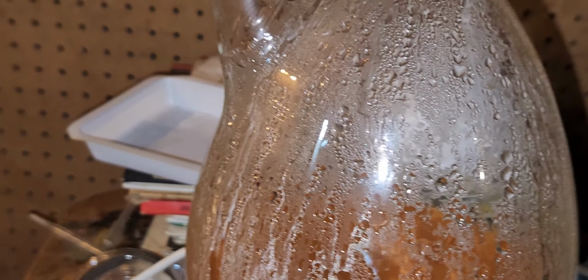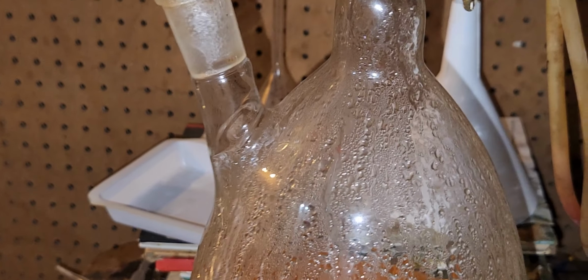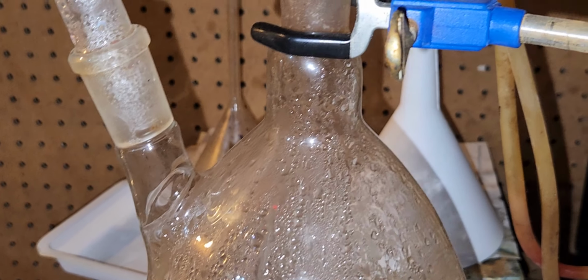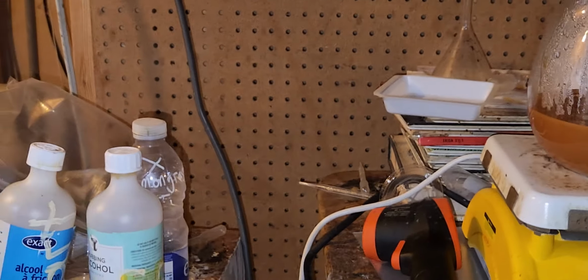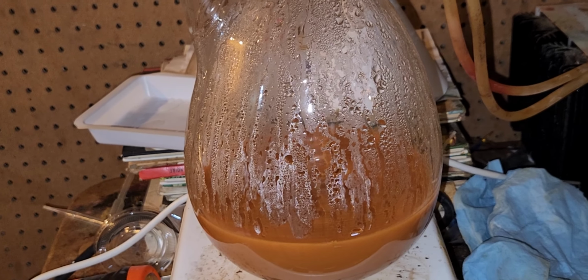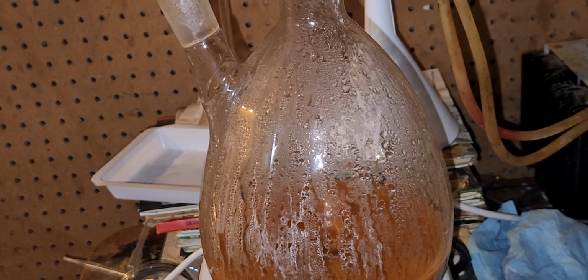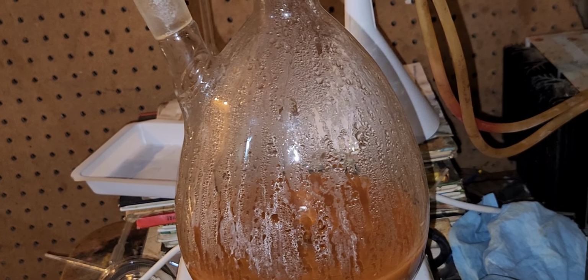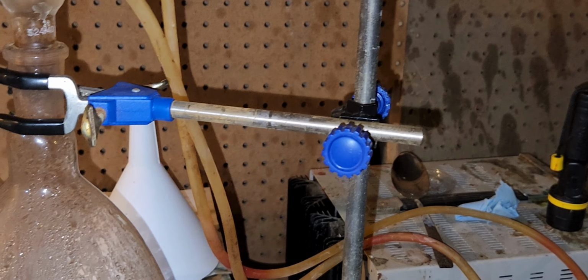Well, this is a good explanation of these videos. I'm gonna keep at it, heat it, and try some more. I keep this at it for hours and hours, and try to get the vanadium pentoxide to create potassium vanadate, KVO3. I should be able to produce about maybe 9 to 10 grams of yield. I lost a lot because of the way it's coating on the flask, but I'm still able to do it.